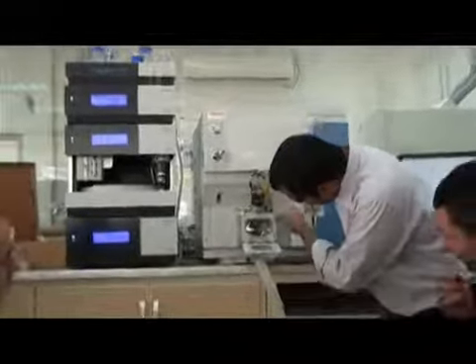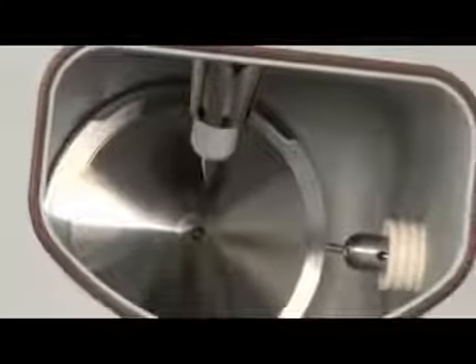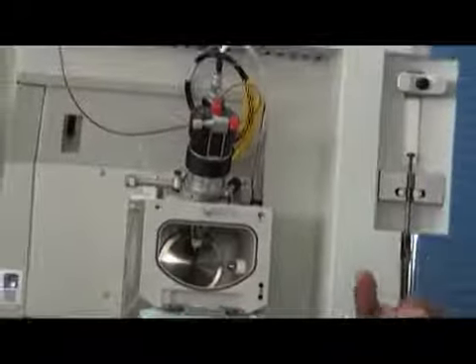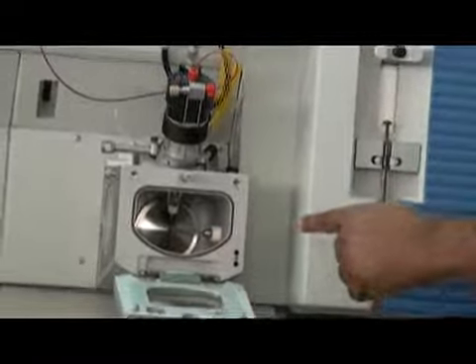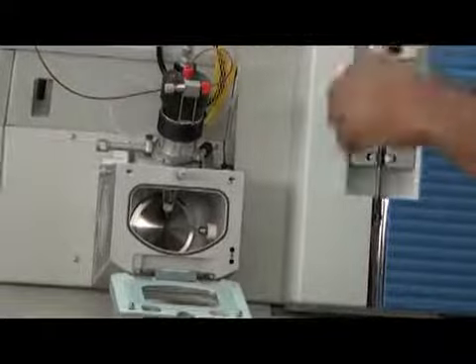You see this probe is coming like this, and the end is coming like this. Then you see another part in the system, this cone. This is called the capillary. So the position is like this, here, and this probe is here. The liquid is coming from here, the mobile phase with the sample, whatever comes here, it comes as a liquid.